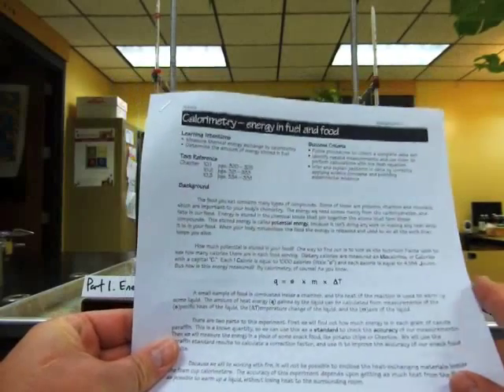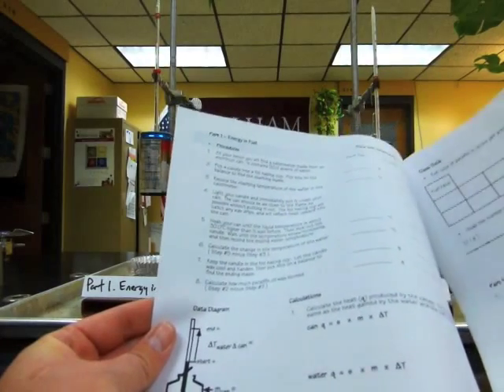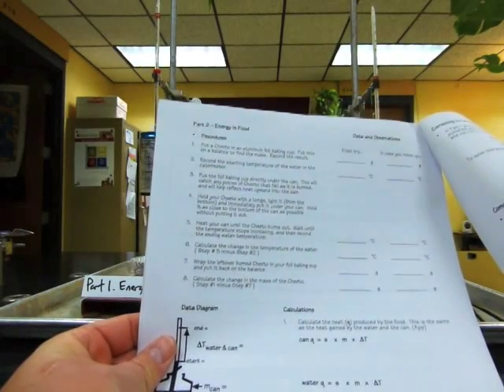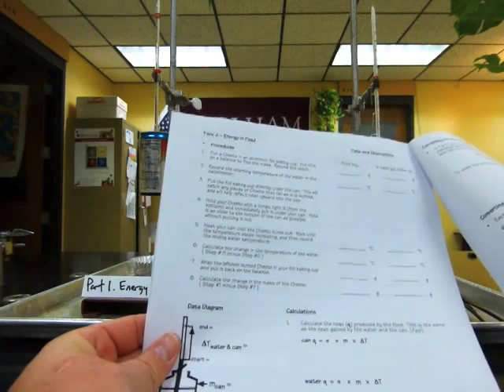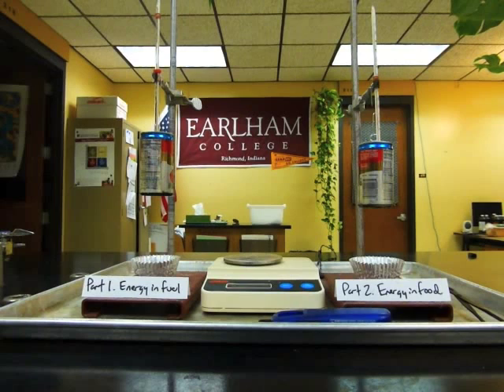What we're going to do is go through a demonstration where I will collect data in the first part of the experiment using a candle, and then I will do the same procedures to find out the energy that's in some food using the Flamin' Hots. Now if you already have data of your own and you're watching this because you want to know how to do the calculations, you can use what I do with my data. If you don't have data of your own, you can use these data. I'm going to go through this rather quickly, so you'll probably want to pause and rewind as you go along.